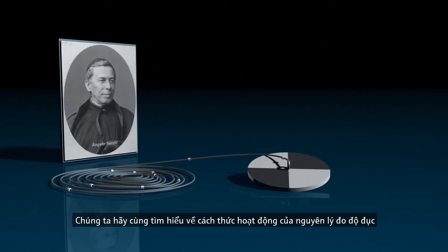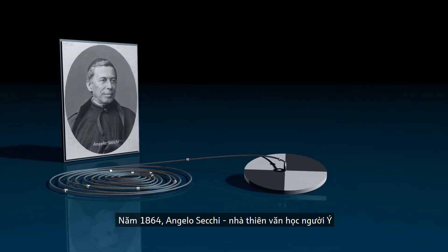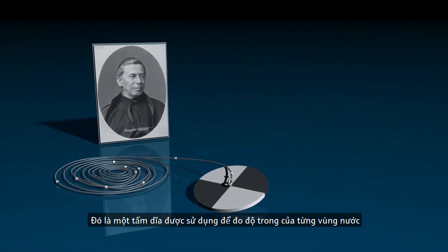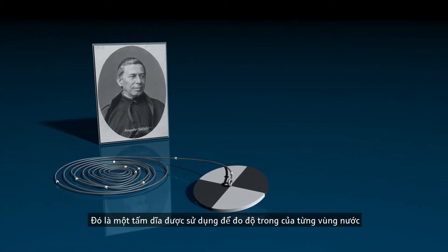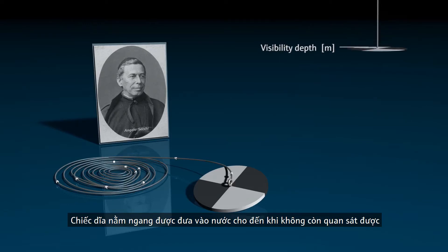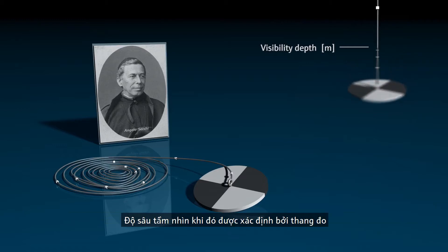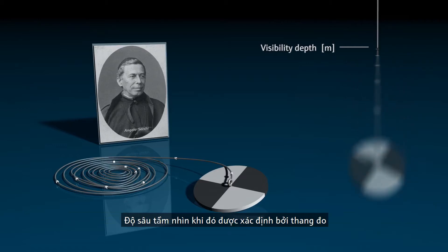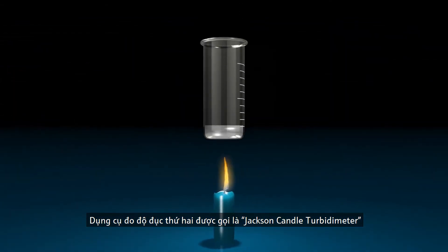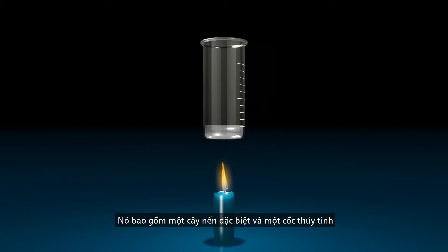Let's take a look at how turbidity measurement works. In 1864, Angelo Secchi, an Italian astronomer, invented the first reference for turbidity measurement — a disc used to measure water transparency in bodies of water. The disc is lowered into the water in a horizontal position until it is no longer visible, and the visibility depth is then determined by the rope scale. The second turbidity reference was the so-called Jackson candle turbidimeter, comprised of a special candle and a glass vessel.